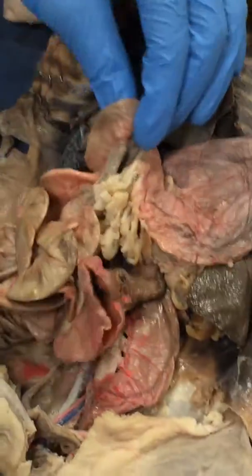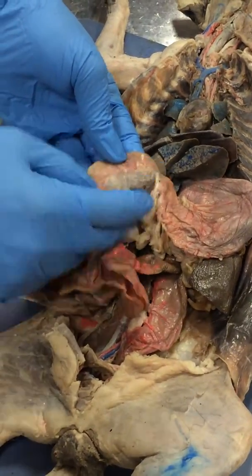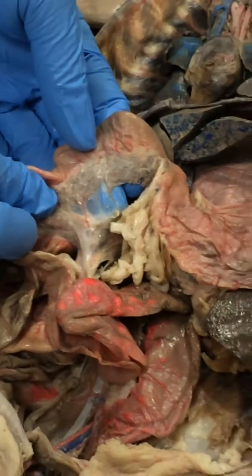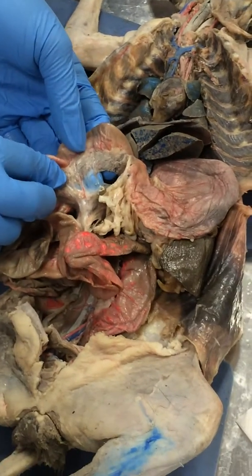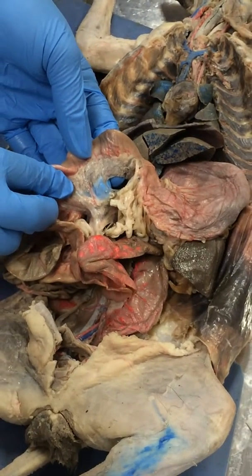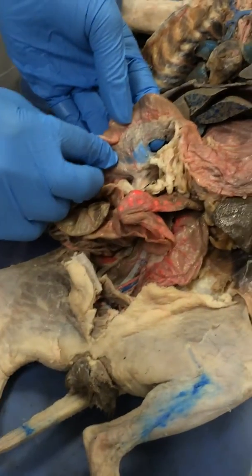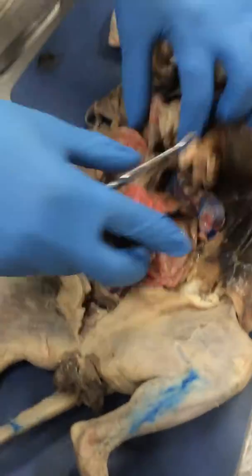And where's the pancreas now? Well, you find the duodenum, and underneath it, running, is the pancreas. It secretes the pancreatic juice. Well, that's the exocrine function. Endocrine is the islets of Langerhans: glucagon, somatostatin, insulin, right? Okay. What else did I miss?